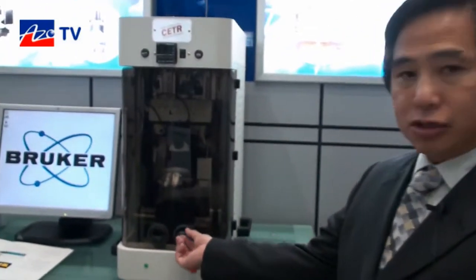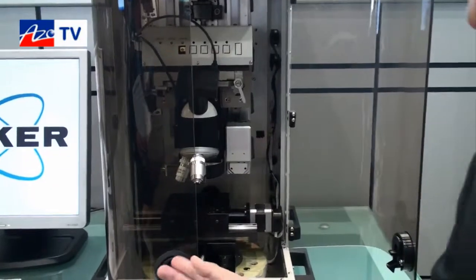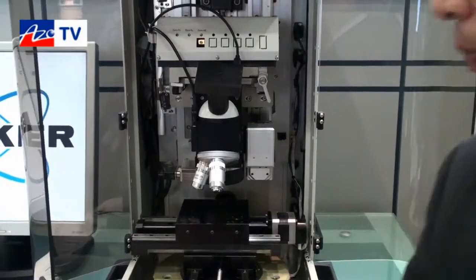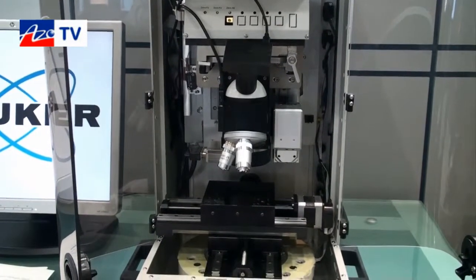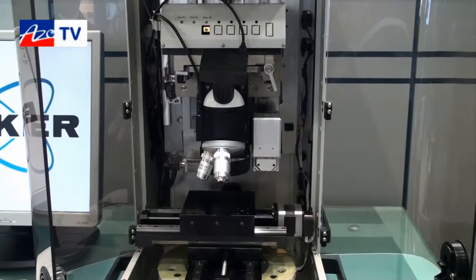Good afternoon. This is the APEX system from Bruker TMT, and the basic function for this tool is to perform nano and micro indentation to get the material properties, especially the mechanical properties like hardness and Young's modulus of the materials and coatings.